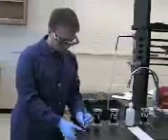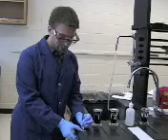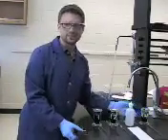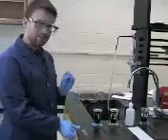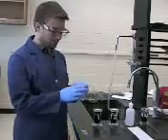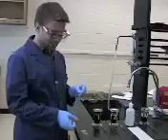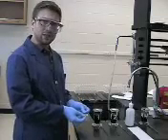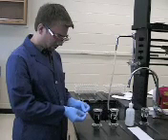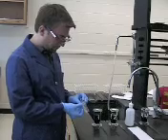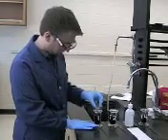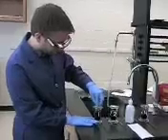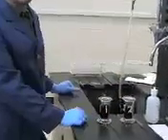So first you're going to want to label the white part of your slide with either your initials or your lab bench number, just so you can identify it. You're then going to want to take a paper clip instead of tape. Your lab manual says to use tape, but we're going to use paper clips instead. They hold on nice and you can give them a little shake afterwards without it flying off. So put your paper clip on. Then what you're going to do is put it into your first jar. There's little grooves in the side of the jar. Just slide it in there. This first jar is crystal violet.